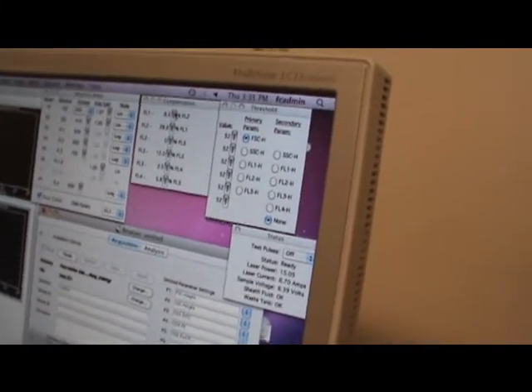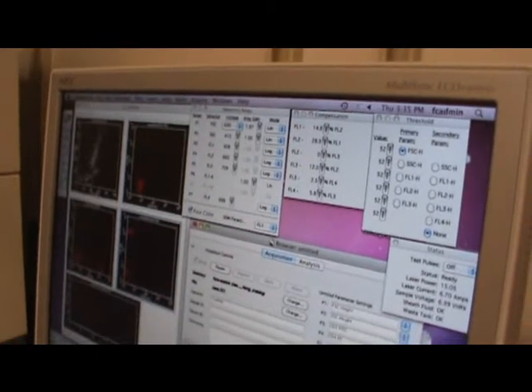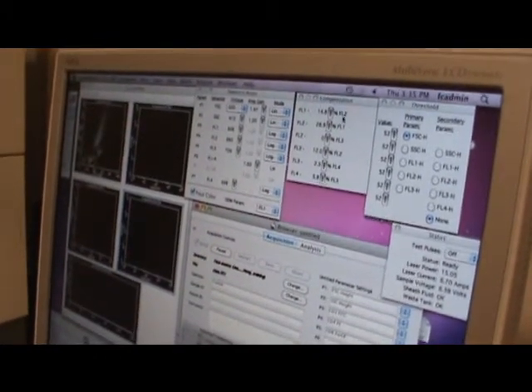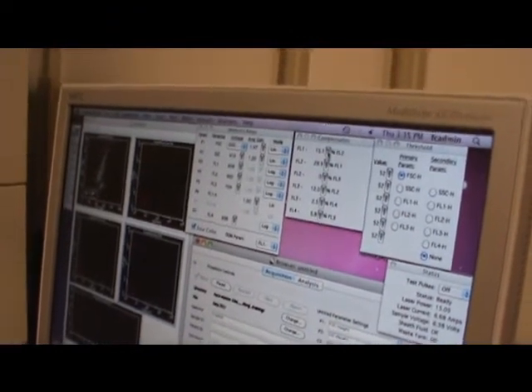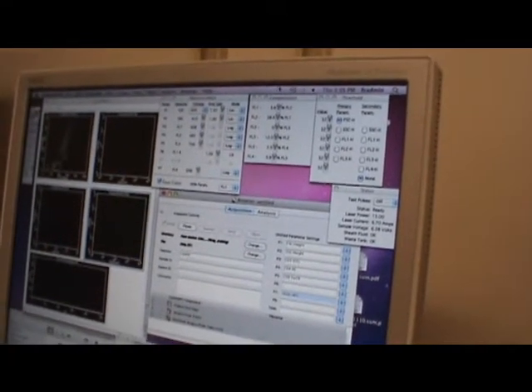And instead, I'm just gonna go. Pause, restart. There we go. See? I just want to show you. Pause, restart. So now my PE is being, because I gave you the calibration file, everything looked very perfect. But I'm changing it to show you when you need compensation.